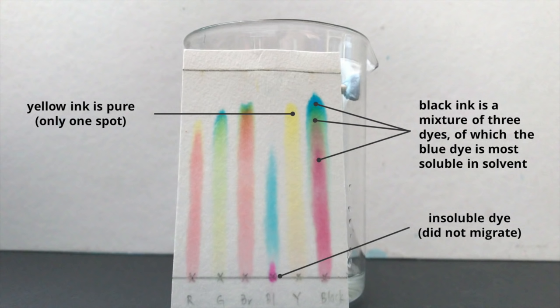For the dyes that were not well separated, we can consider changing the solvent.